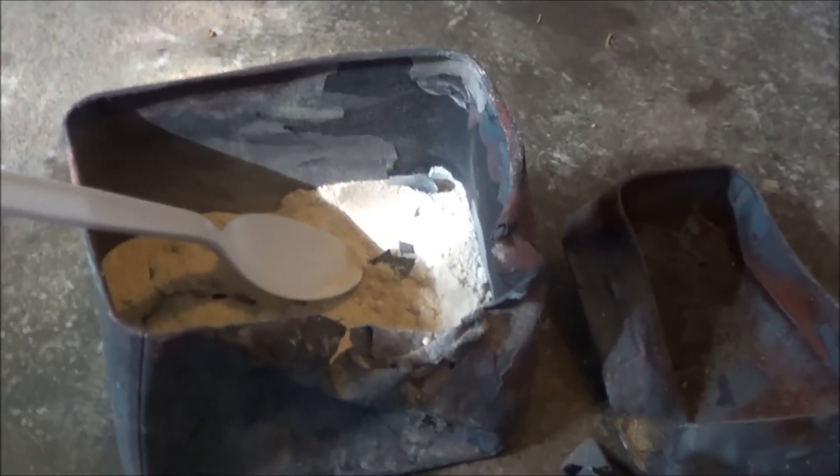It's been annoying because I've got a bit of iron oxide that's fallen in from the side of the container, but I'm going to have to physically separate that out. It's a pretty low amount compared to the amount of cyanamide we have in there. The container got quite hacked up in the fire — I think a log must have really fallen on it. It was quite a struggle to get the lid off — I had to use the hammer. I was worried I'd have to break out the angle grinder to get it open, but I didn't. So I guess now we're going to have to do some tests to see if we actually just completely destroyed this via oxidation, or if it is what we want.